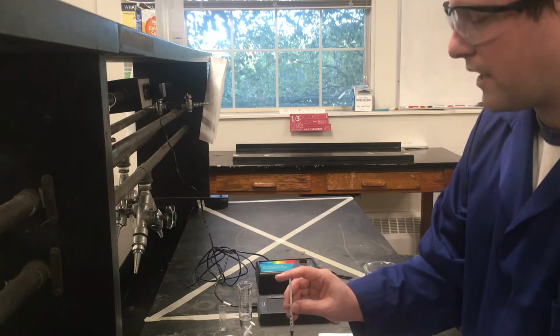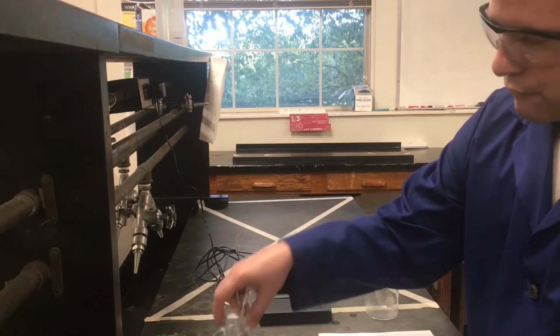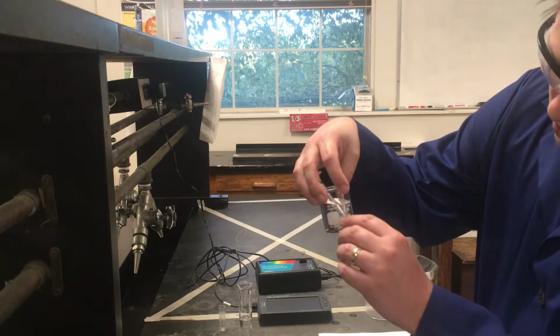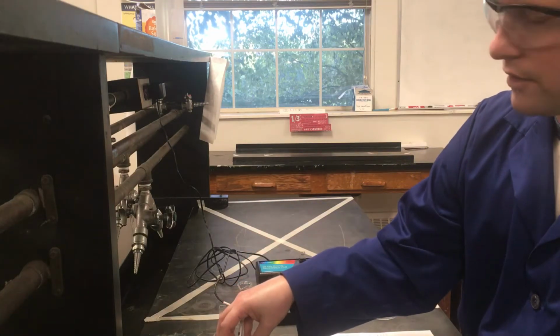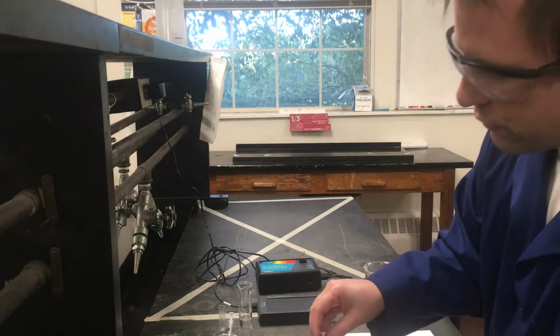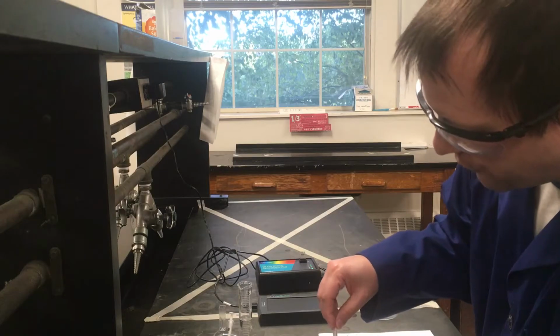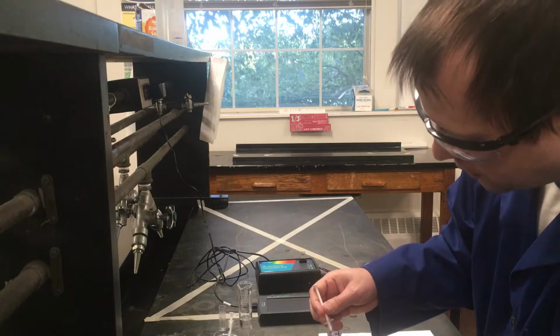This is something I want to point out because I know a lot of people do this lab. You're given a bunch of small beakers, like I have a small beaker of water here, and people just measure between the 15 and 20 marks and say, oh, that's 15. Well, that's not really accurate enough. Also, the markings on beakers usually aren't very accurate for their volumes. You're much better off using a graduated cylinder to make your measurement.